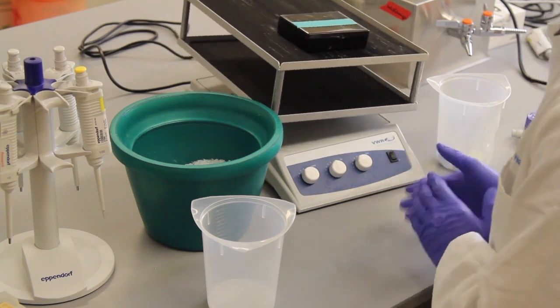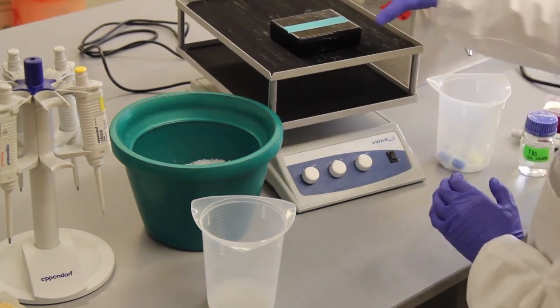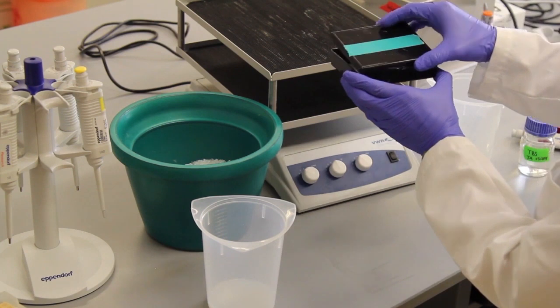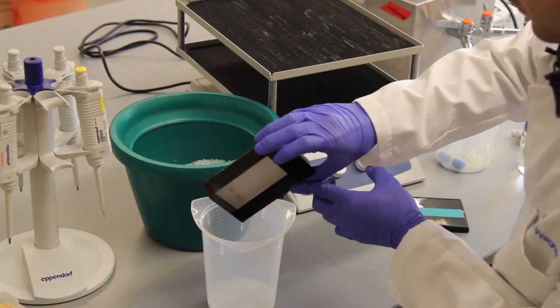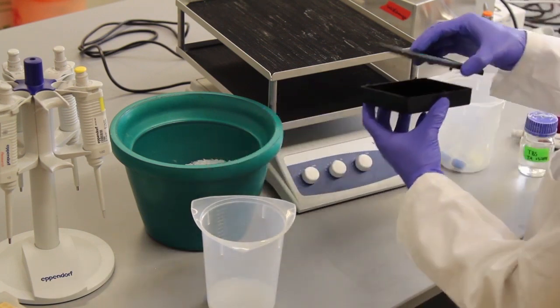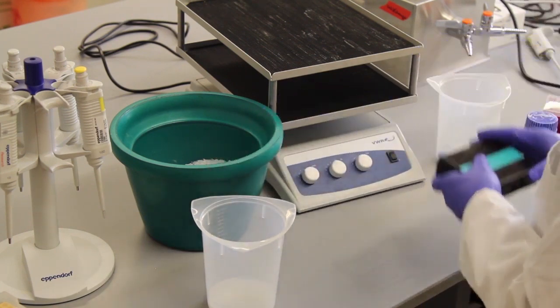This is the end of the third wash after adding the secondary antibody, which means all of the antibody steps are now done. All of the wash steps are now done. I'm going to dump the liquid one more time. And we can now take the membrane to the imager and see what we have.